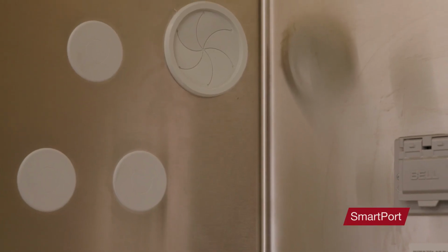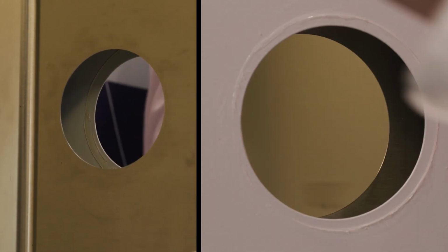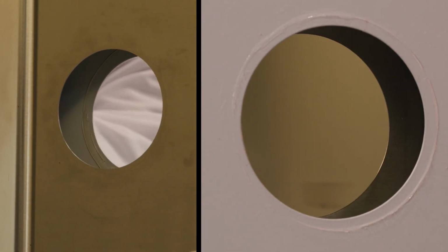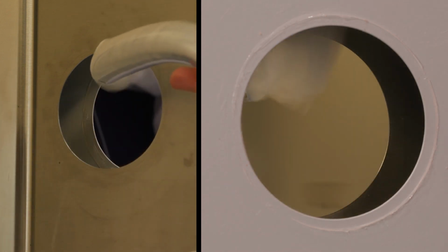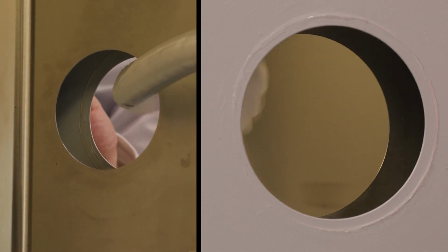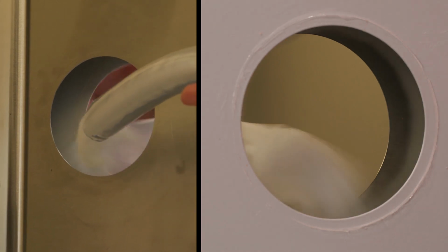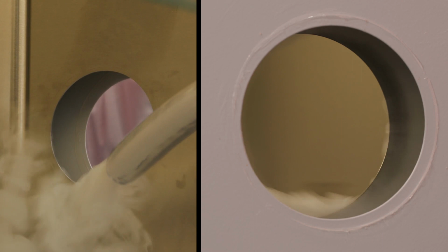We're looking at the operation of the SmartPort grommet. We've actually removed the grommets to make it an even more challenging test. Now, Natasha, if you could bring the smoke in from your side, up high above the opening, and notice how none of that smoke is getting through. You can push it to the hole a little bit more, not in the hole, but yeah, it's getting contained from that side. So let's go ahead and try it from the other side.